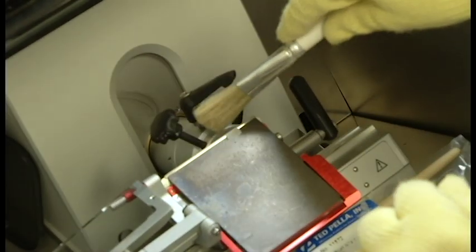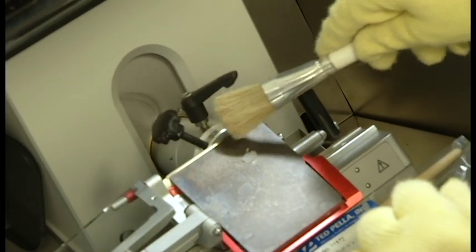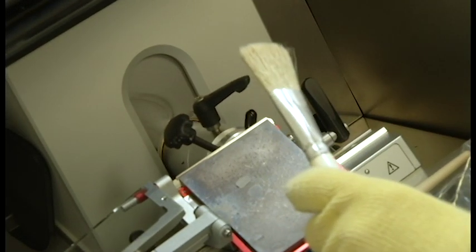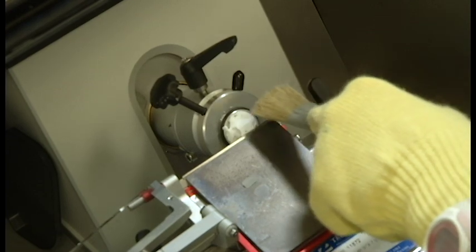Once you have a slice that you are happy with, move it to a lower area of the stage so that it is not accidentally knocked off. You can gather several slices to be picked up at once with one slide.